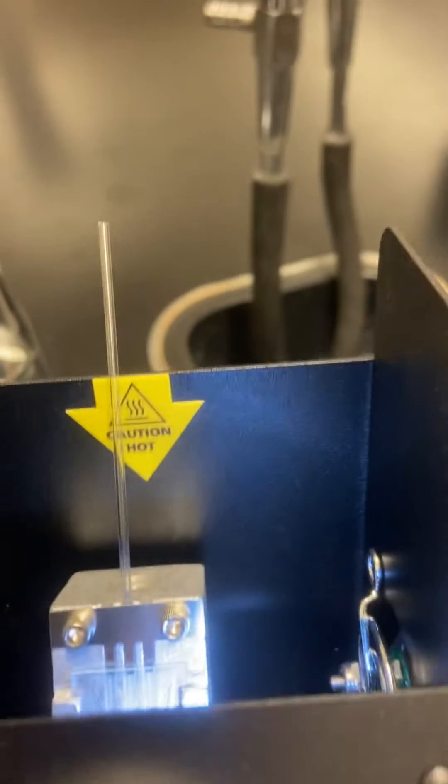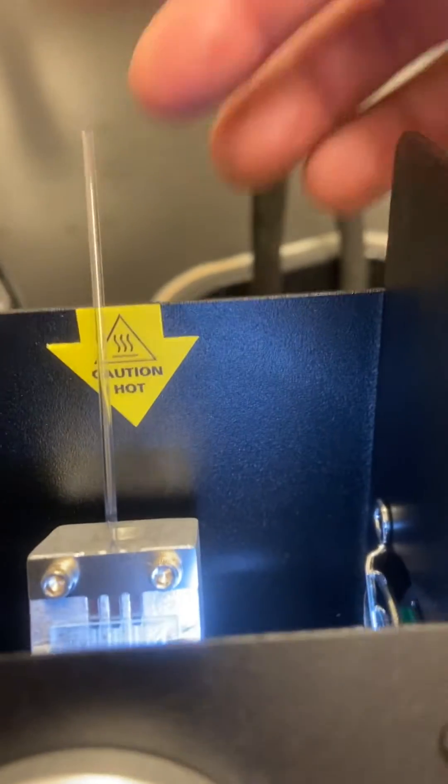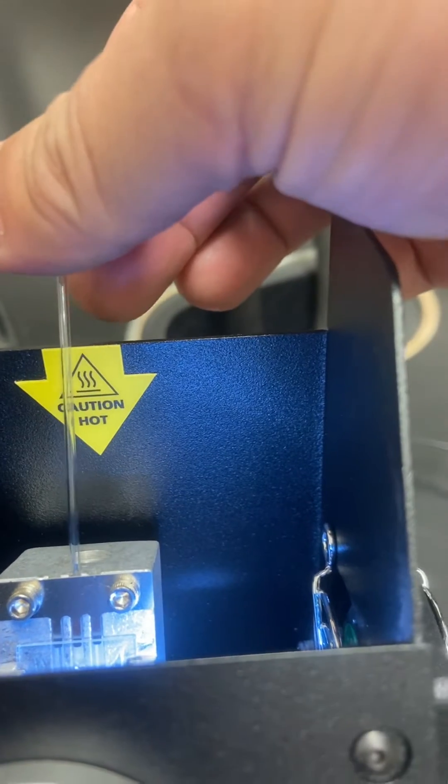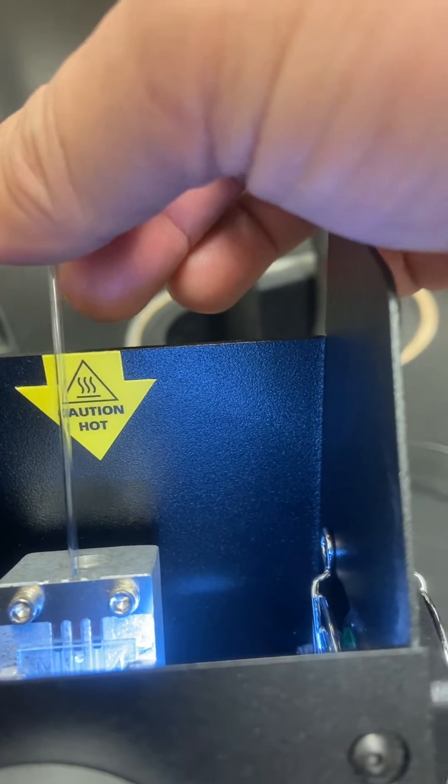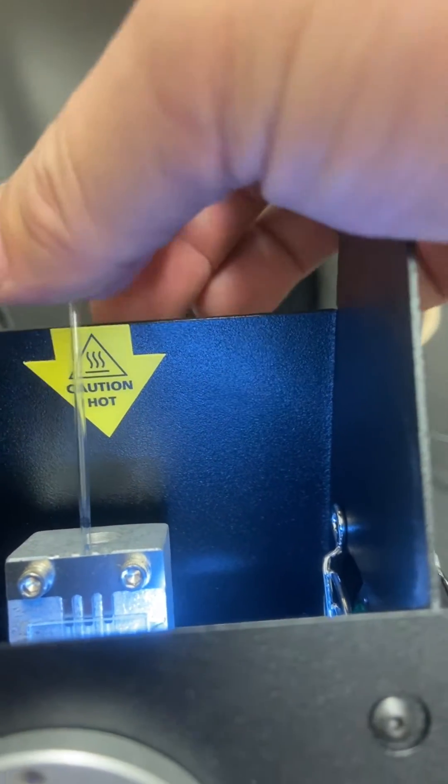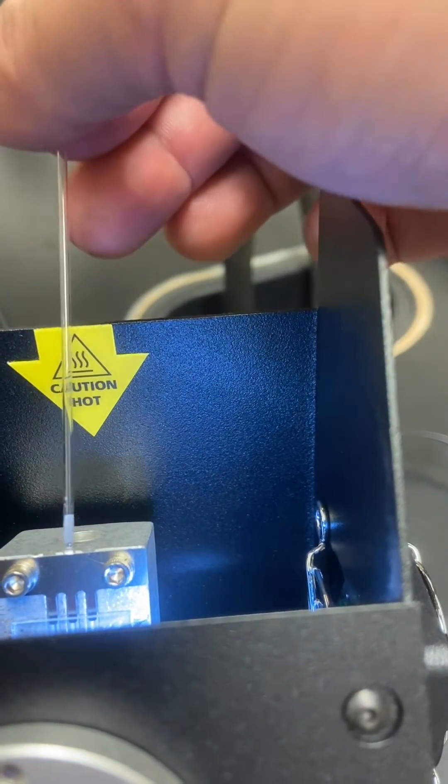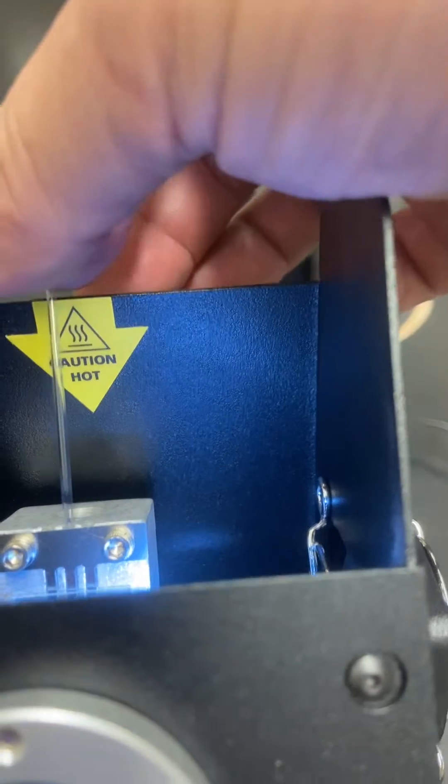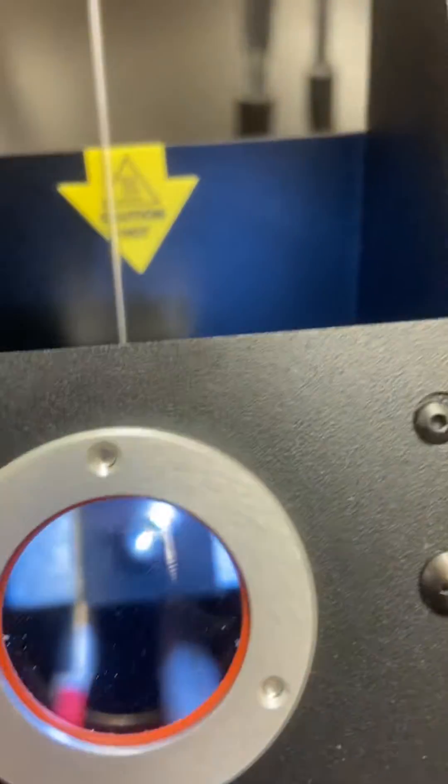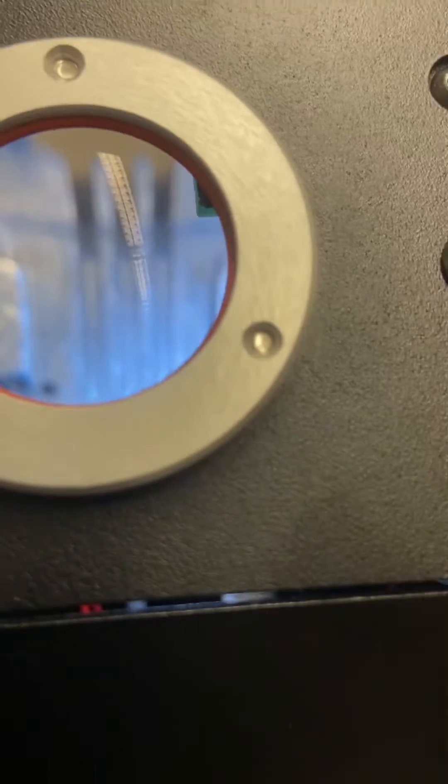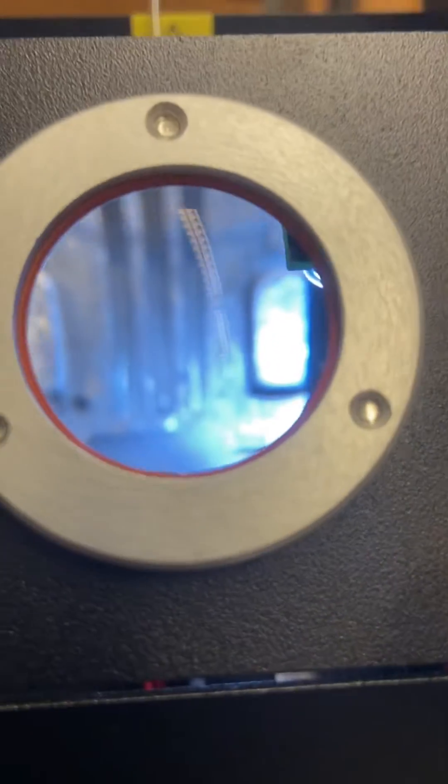If we look through the lens, we can see some sample inside. It's easier to see this capillary tube. It's a little bit hard to see this through the camera, but it's easier to see it using your eyes.